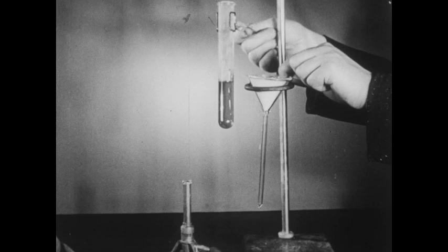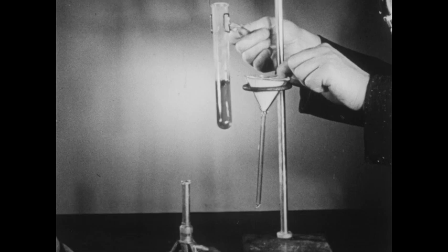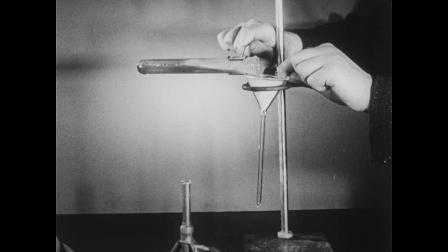However, in this test tube, I've placed several grams of sulfur and have then melted this sulfur over the Bunsen burner. The sulfur is now liquid and at a temperature somewhat above its melting point. We'll now pour this molten sulfur into this funnel.